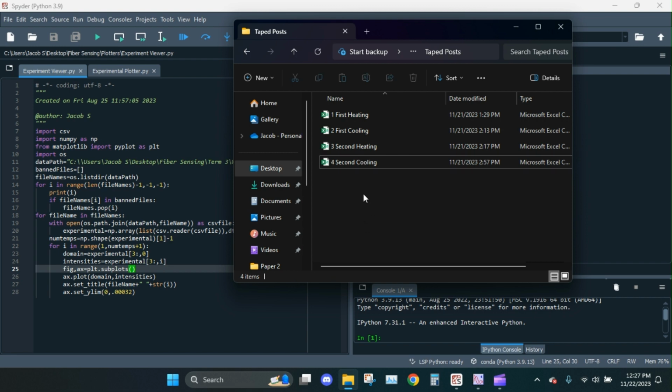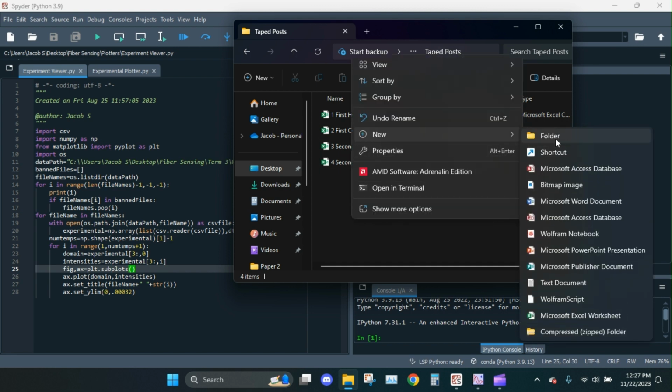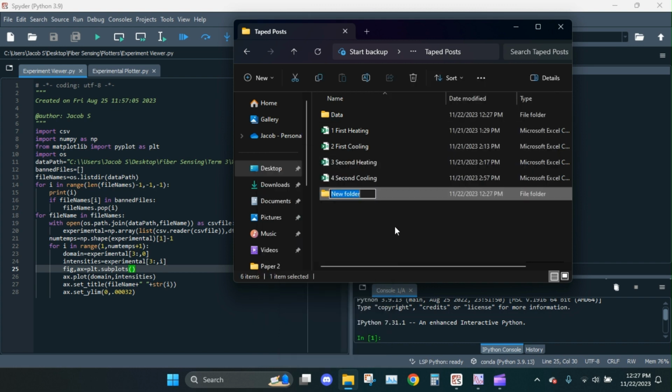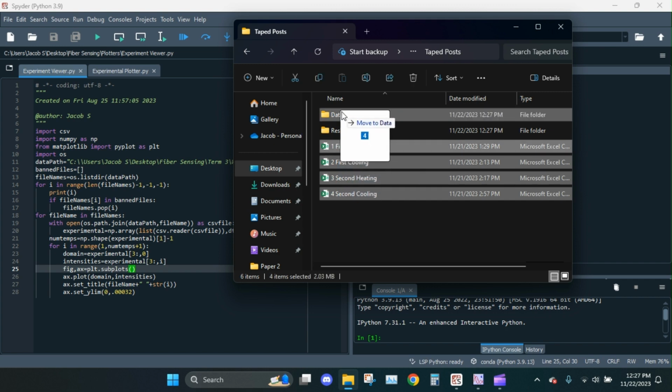Okay. And furthermore, I'm currently in a folder called taped posts. And just how I like to organize things, I'm going to have one folder for the data. I'm going to make another folder for results. That'll come in handy later. For now, let's grab all these, put them into data.